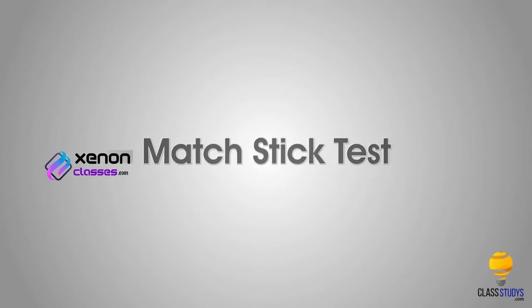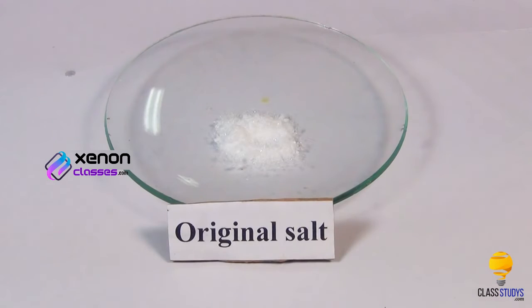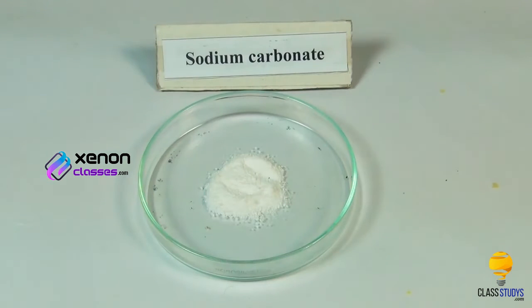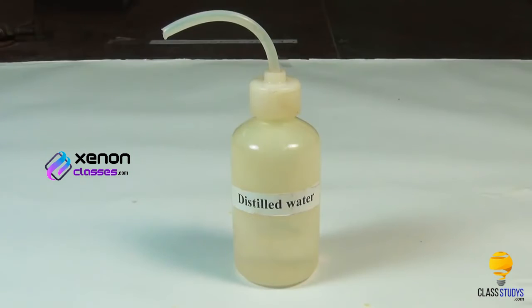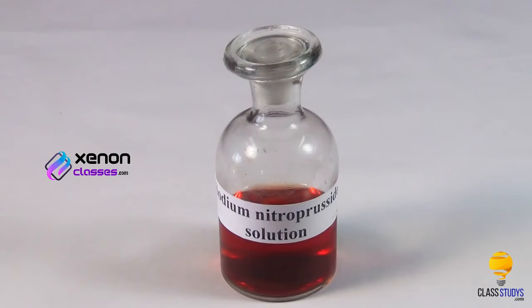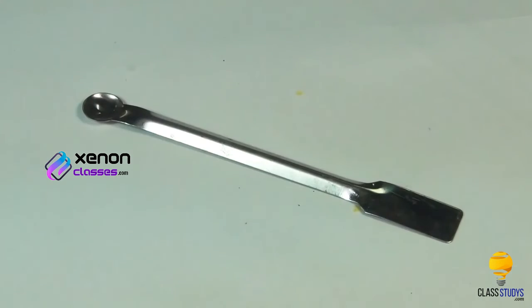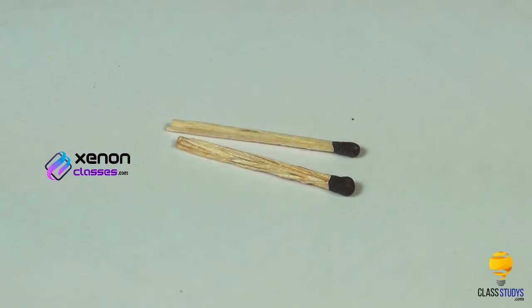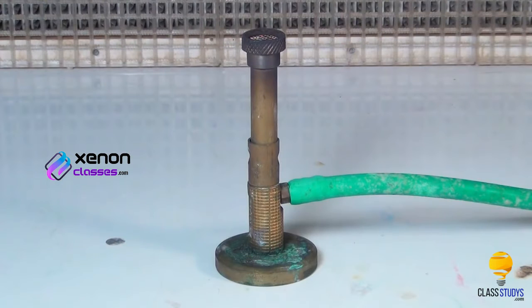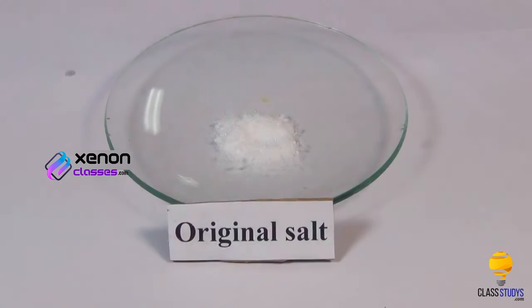Matchstick test. Materials required: original salt, solid sodium carbonate, powdered charcoal, distilled water, sodium nitroprusside solution, watch glass, spatula, glass rod, wooden splinter, china dish, and Bunsen burner. Procedure: take a small amount of the salt in the watch glass.